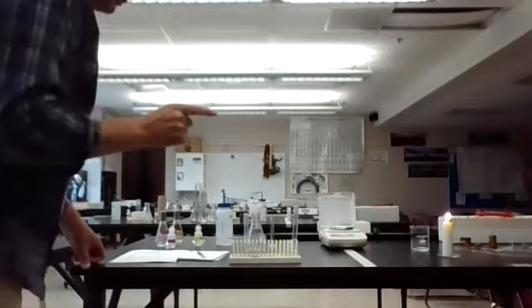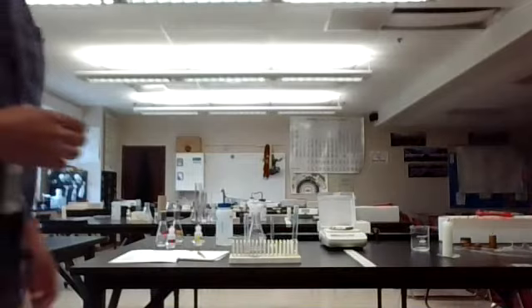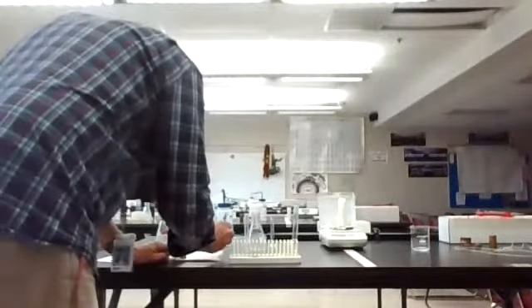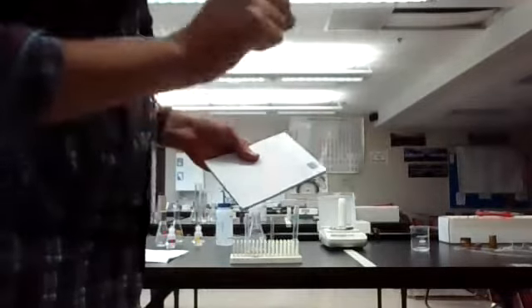Okay. Next, before we do anything else, let's finish the candle. So I have to blow this out. All right, we want to mass the candle a second time. So we'll let it go until it comes to rest. So this is our mass after: 100.90 grams. So I want to repeat. When I started burning the candle, the mass was 101.43 grams. After, 100.90 grams, mass was lost.